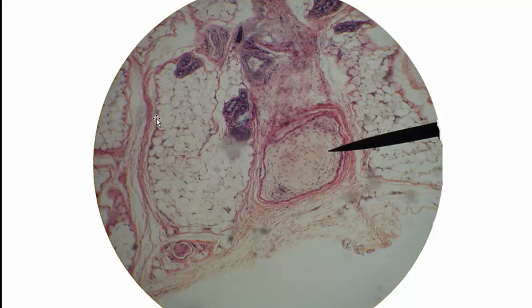In case you're wondering, these structures going by in this direction and heading off in that direction are another type of connective tissue. This would be a form of dense connective tissue. Lots of collagen, that's the word I was tripping on before. These are collagen fibers going by.